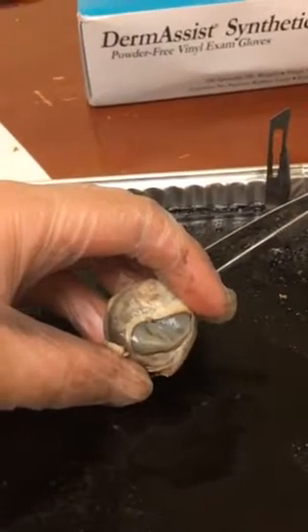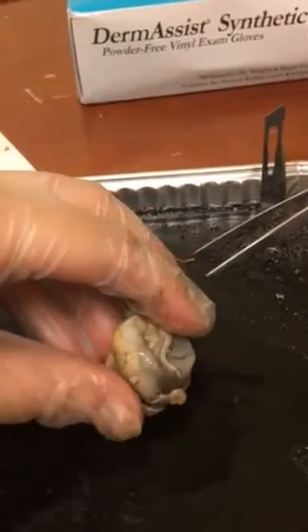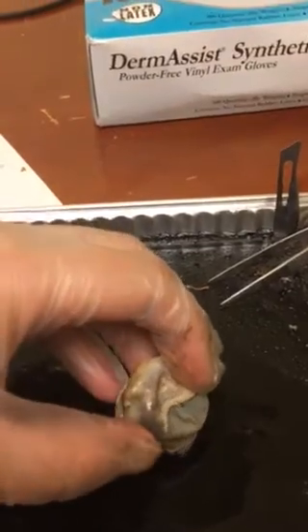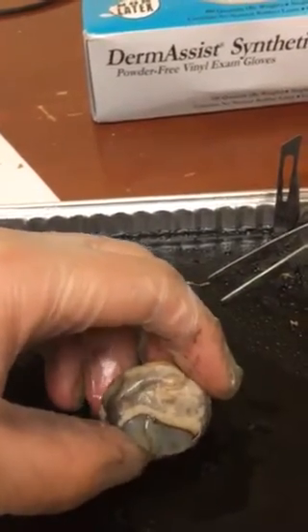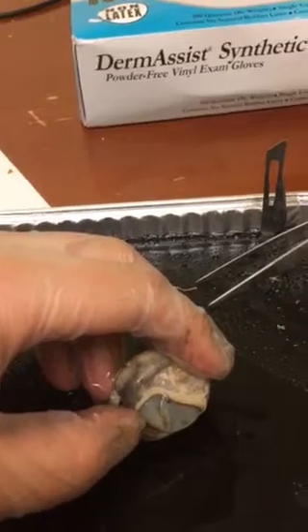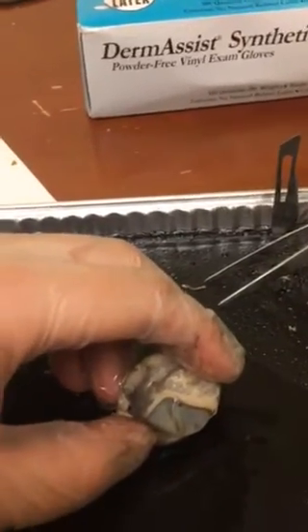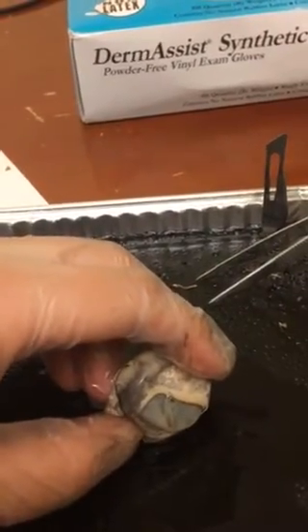So as we dissect the eyeball here, before we make any incisions, we take note of the sclera, which is the outer covering of the eyeball. It's a tough and opaque sheet of connective tissue that protects the inner structures of the eyeball and helps maintain the rigidity. And then up front here we have the cornea, which is cloudy in this specimen, but it's a transparent covering that allows the light to enter the eyeball at the front of the eye.